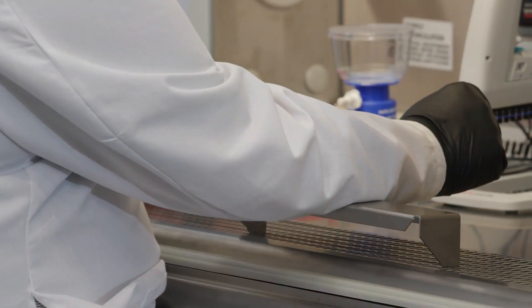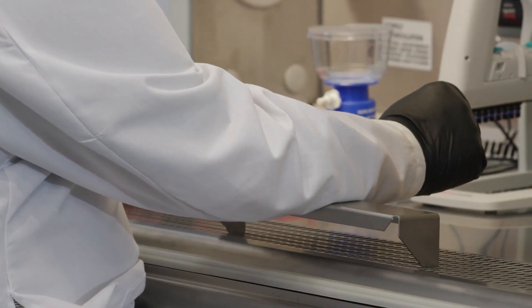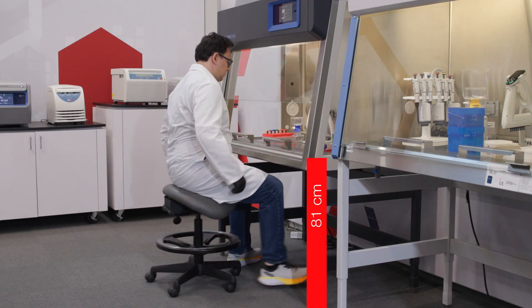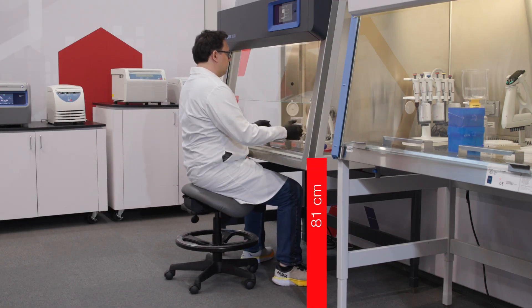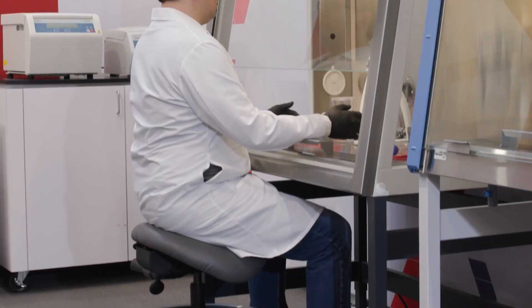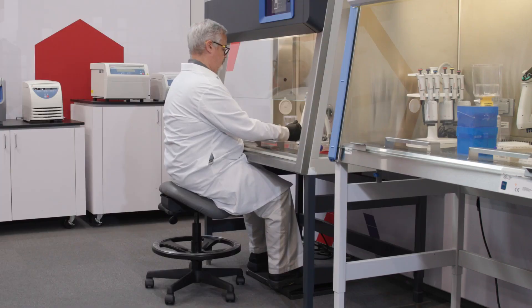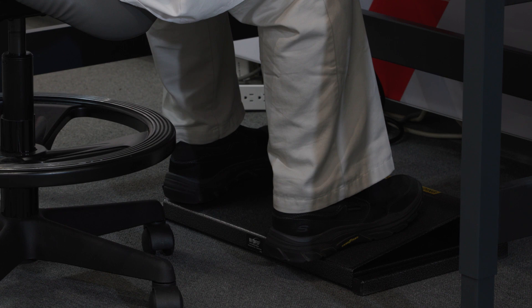Remember, we adjust to achieve the forearms parallel to the ground and elbow angled 90 to 120 degrees. It's the same for Aaron at the raised cabinet with no other changes — the saddle stool is set at 60 centimeters and he does not need the footrest. For Dave at the raised cabinet, the saddle stool is at 62 centimeters and the footrest as before.